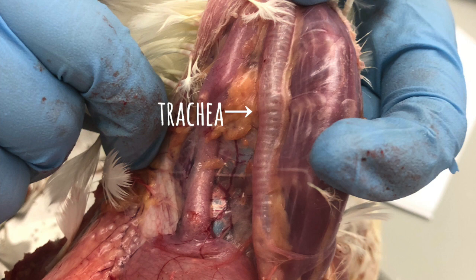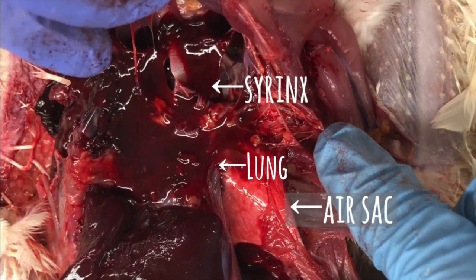The trachea has cartilaginous rings that prevent it from collapsing due to negative pressure exerted when the chicken breathes, and the glottis is the opening to the trachea. The syrinx is responsible for avian phonation, and the lungs actually have no expansion during respiration. Instead, chickens have air sacs, which are thin-walled extensions from the lungs. They have one pair in the abdominal cavity dorsolateral to the intestines, and two pairs of air sacs in the cranial and caudal thorax, which penetrate into the septum.